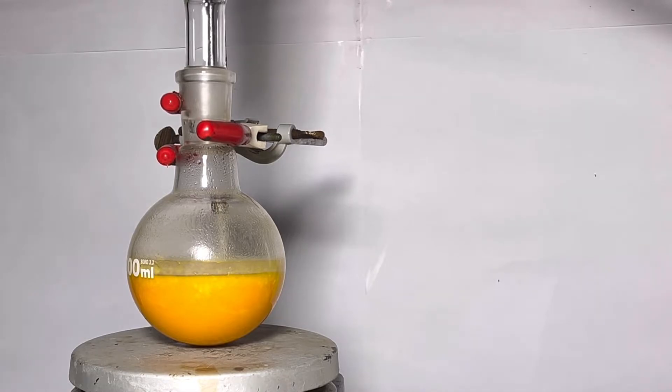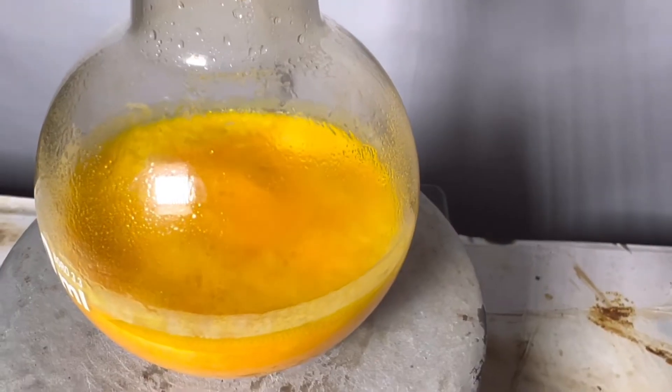The complete reaction took about 1.5 hours and finally we have a bright yellow colored solution with abundant precipitate of magnesium hydroxide. The contents of the flask clearly looks like mango juice.